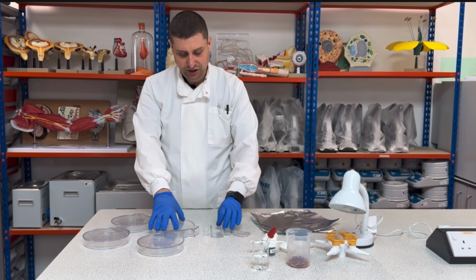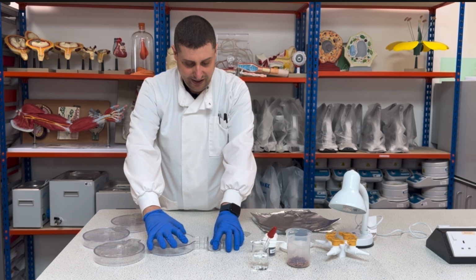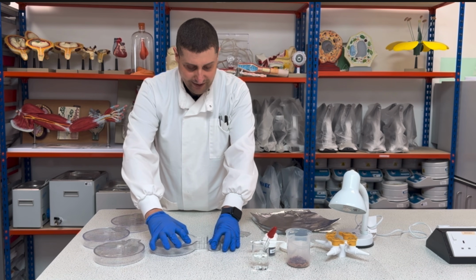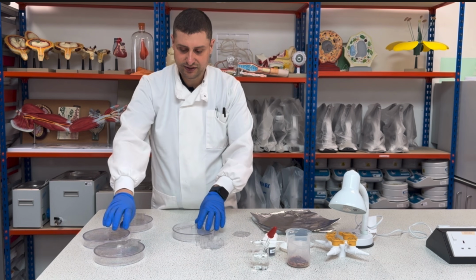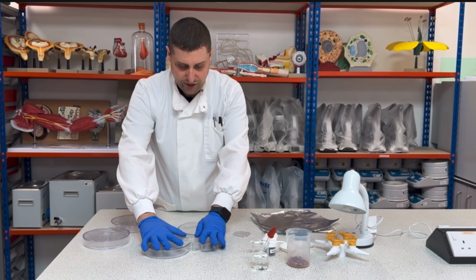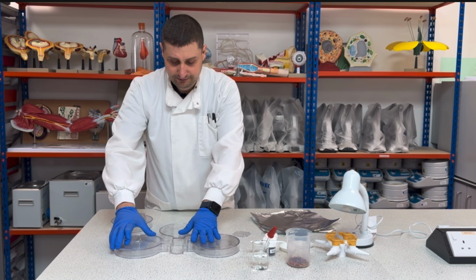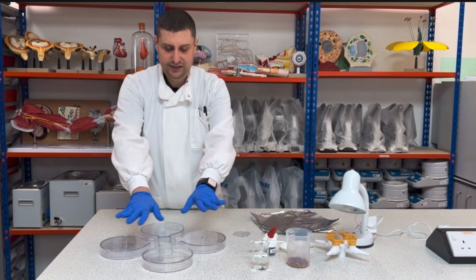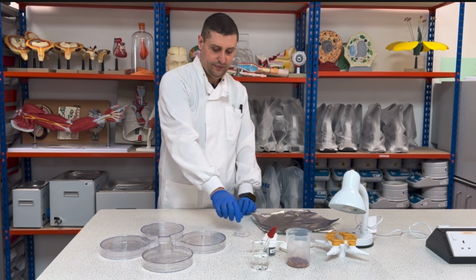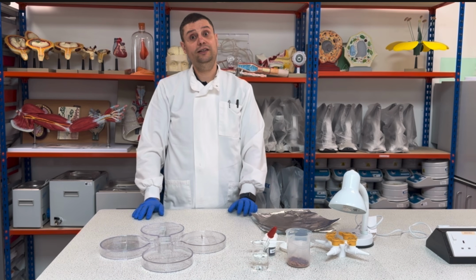So basically what you need to do is take the center one and just slide it inside. When you hear the click, it's fixed. Then you do it again with the other one. Click again, and the last. So this is my choice chamber made, and this is the lid for the internal chamber.